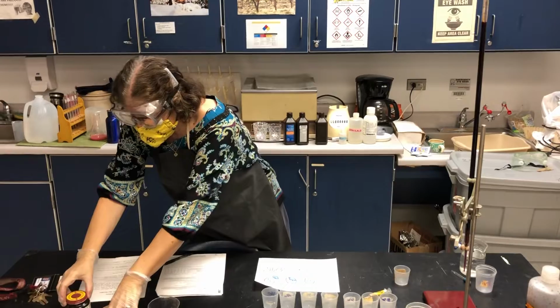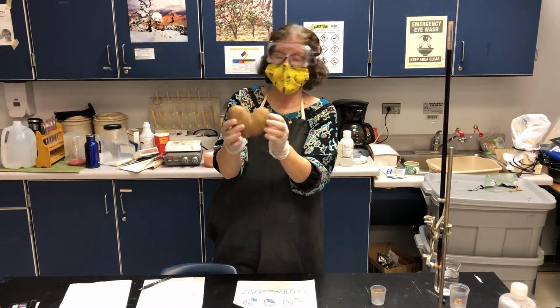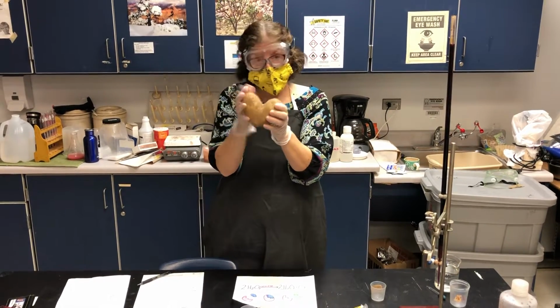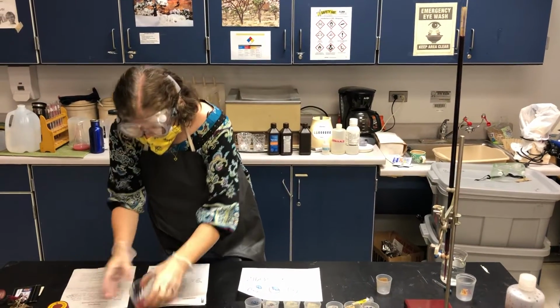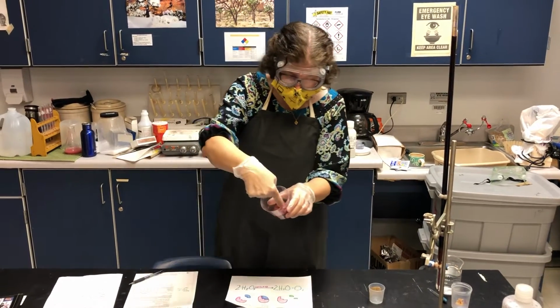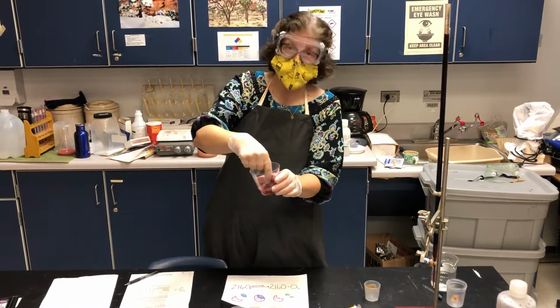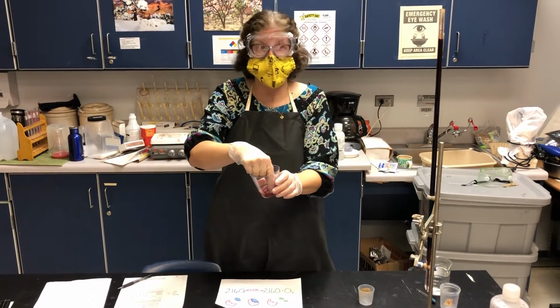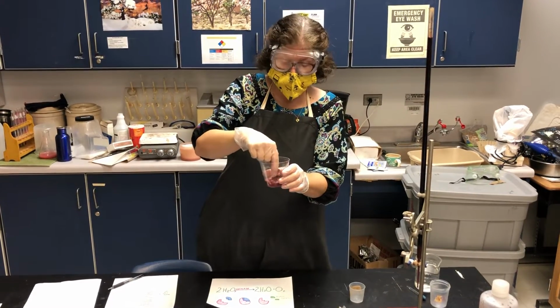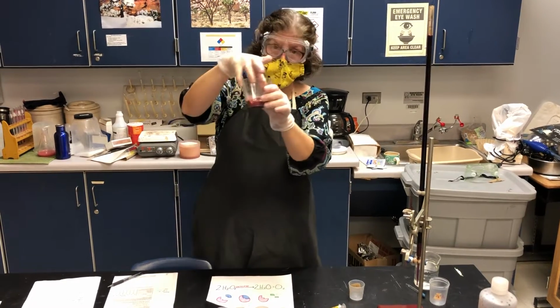And you would also find them in plant material like potatoes. If I cut up a potato, this is my heart potato, I love this potato, you would find it in potato matter, and you would find it in this lovely stuff. This is actually fresh chicken liver that I just bought this afternoon. It's very rich because liver, as you know, is an organ whose main purpose is to detoxify. It has a lot of peroxisomes in the cells, so it's a very good source of catalase.